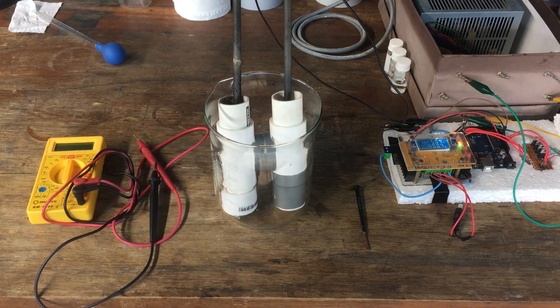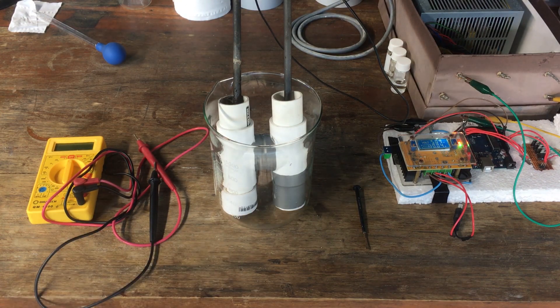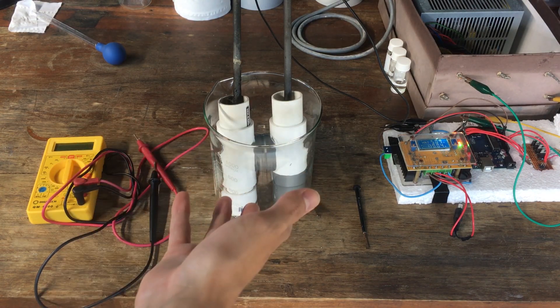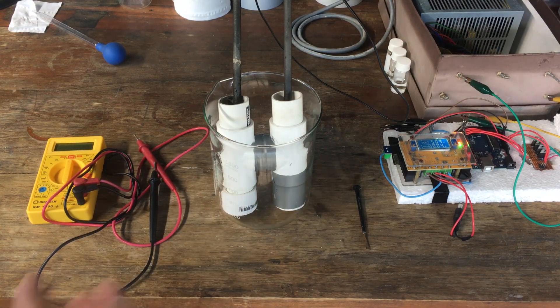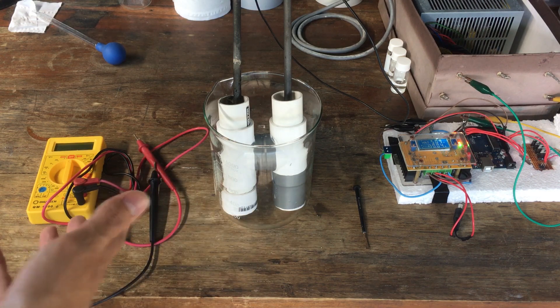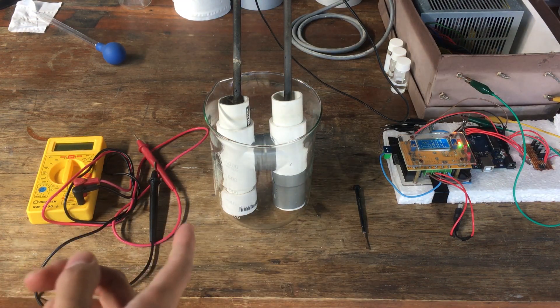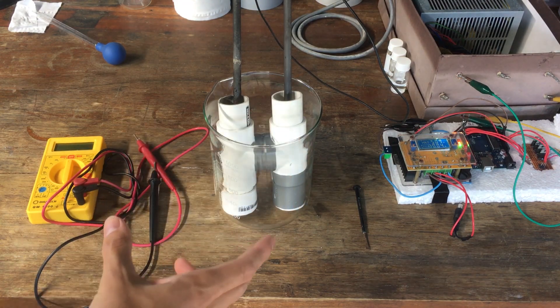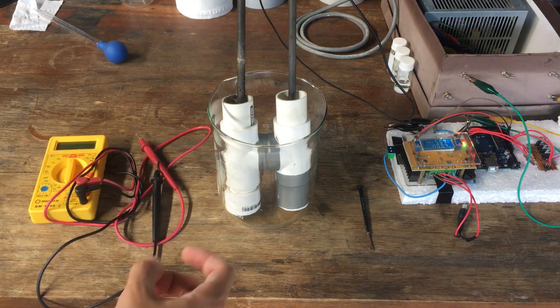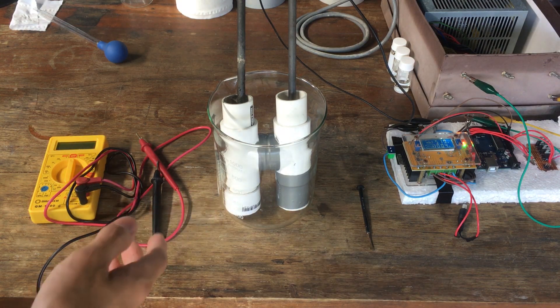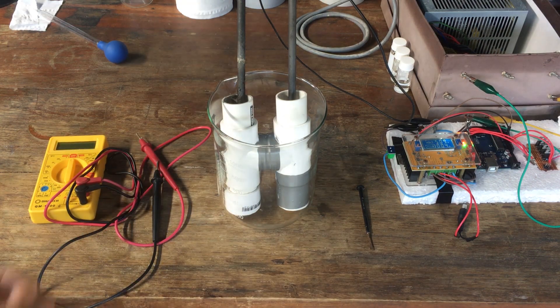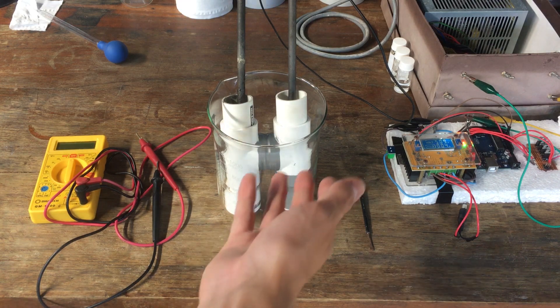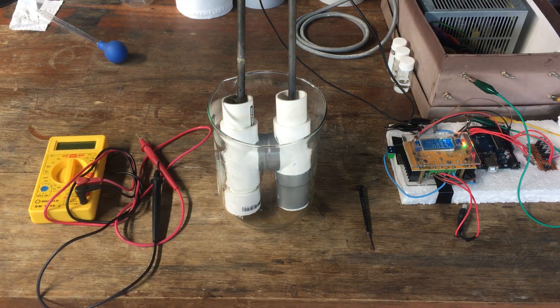So yes, here we are doing some testing for our potassium hydroxide electrolysis process. What I really wanted to do here was test the efficiency of the potassium hydroxide chloralkali diaphragm cell electrolysis versus the same process involving sodium hydroxide. You can see we're doing exactly the same thing as we were doing in our previous chloralkali testing video, where we use our standardized diaphragm electrolysis cell. We fill the anode chamber with a solution containing either sodium or potassium salt. In this case, what I'm doing right now is the potassium run. And then we electrolyze with carbon electrodes and form the corresponding hydroxide in the cathode chamber. I've gone over how this works many times, and I won't bore you with explaining it again.